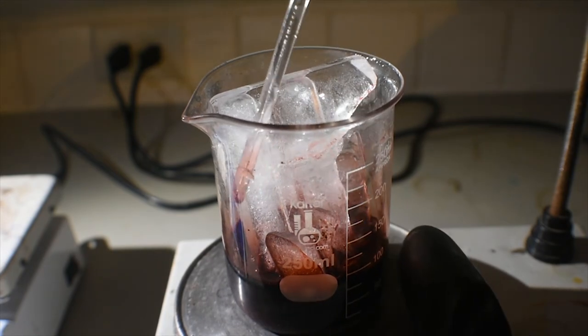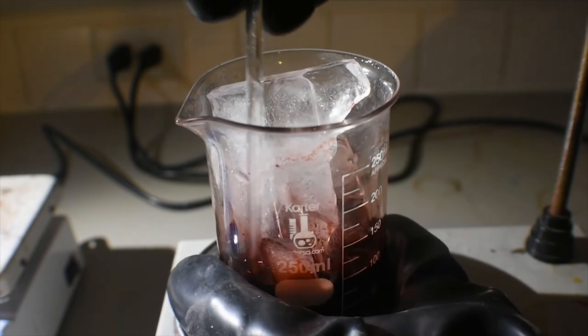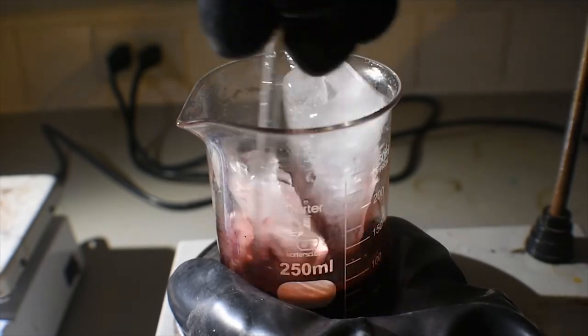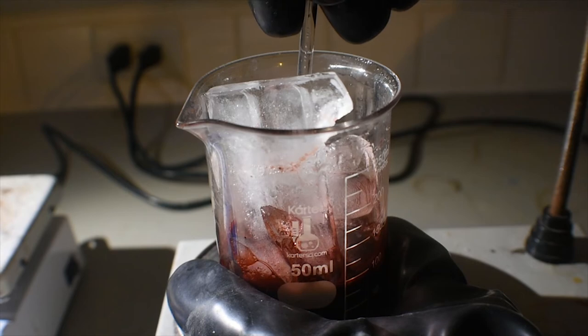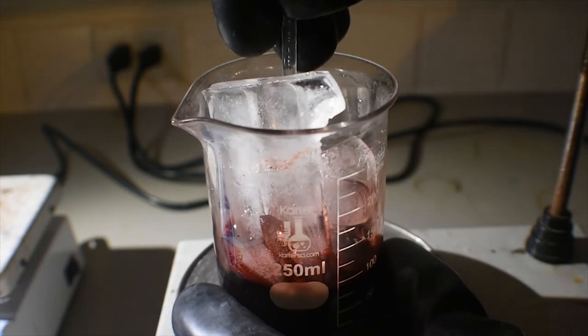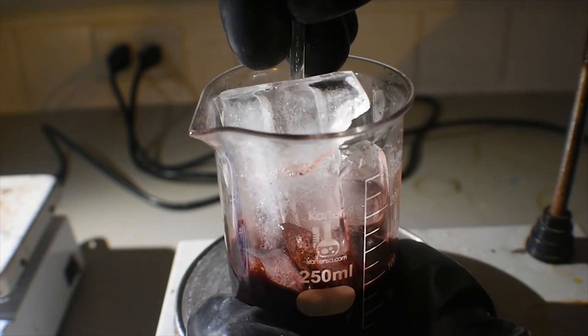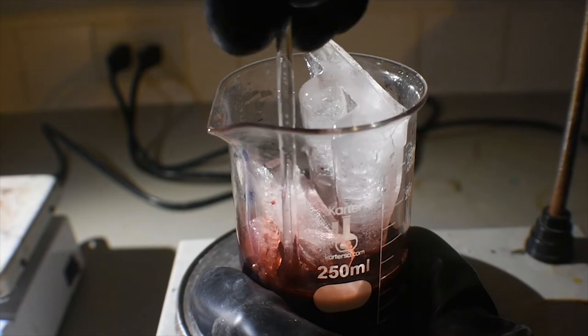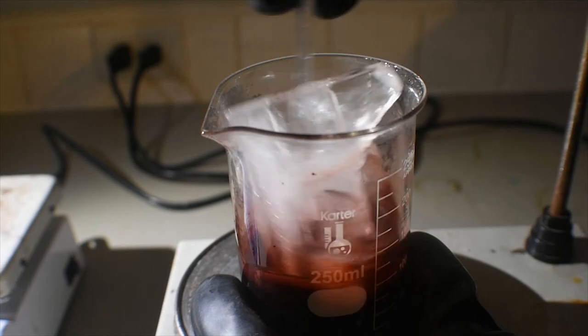Now, I'm just gonna continue stirring this around until the ice is pretty much gone and the evolution of CO2 stops. This went actually a lot better than I thought it would. It didn't blow up, it didn't catch fire, and it didn't create a giant smoke bomb like I thought it might. So, hey, win-win. Looks like I'm getting my complex and I'm not dead. That's all that's nice.